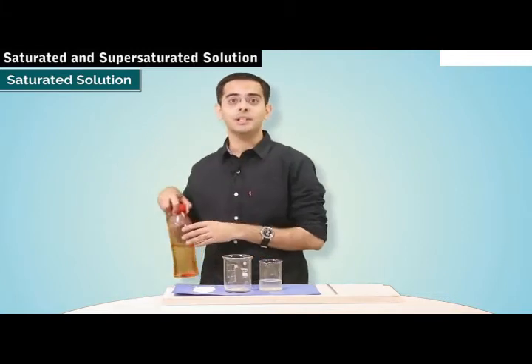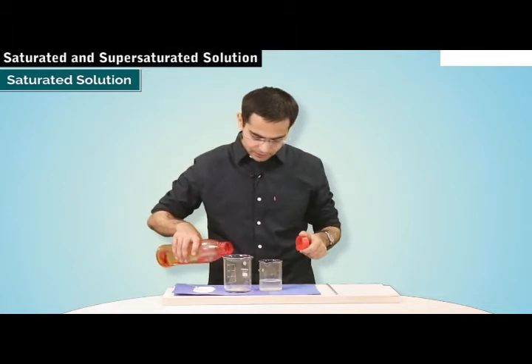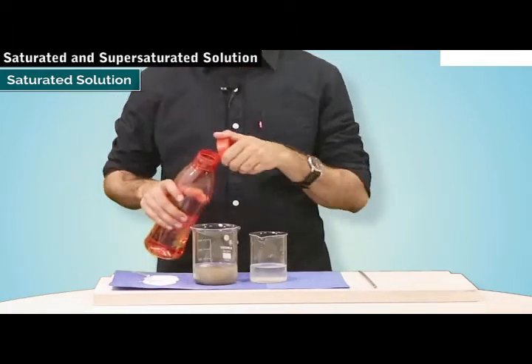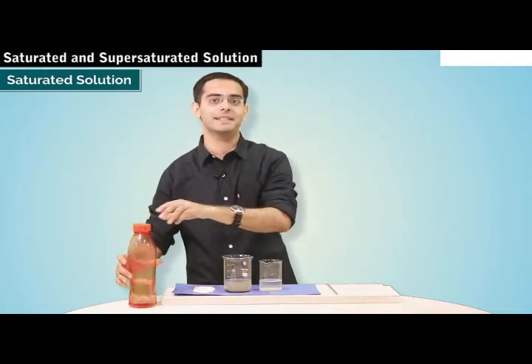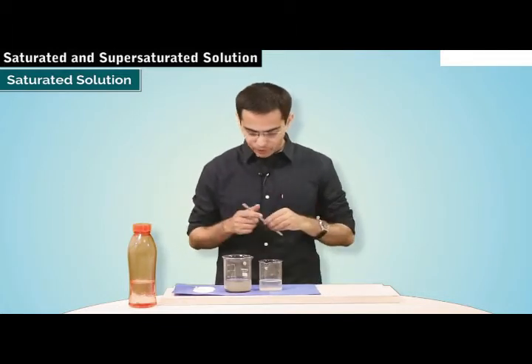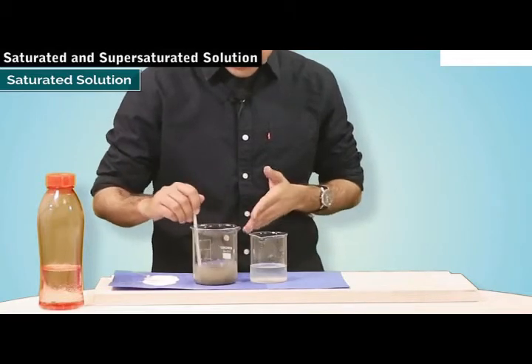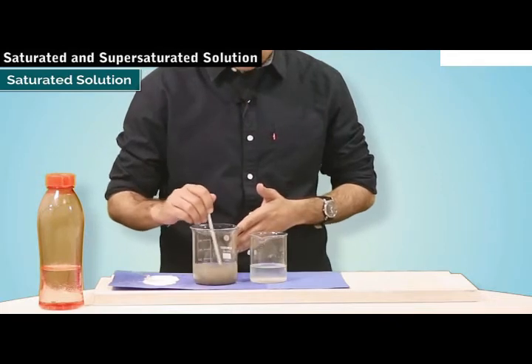Well, we can recover the undissolved salt from the sand by using a large quantity of water. So here I am going to add more water, because water will dissolve all the salt particles now. Now that we have added the water, I stir it so that the undissolved salt gets dissolved into the water.